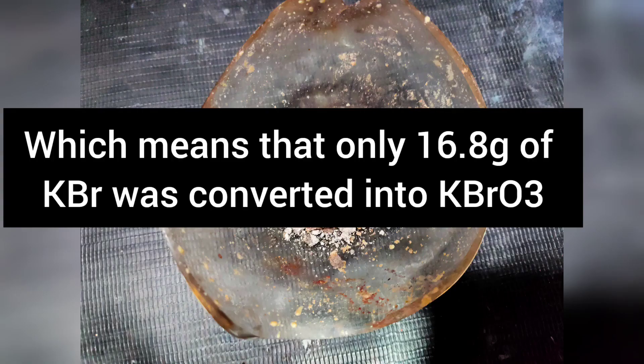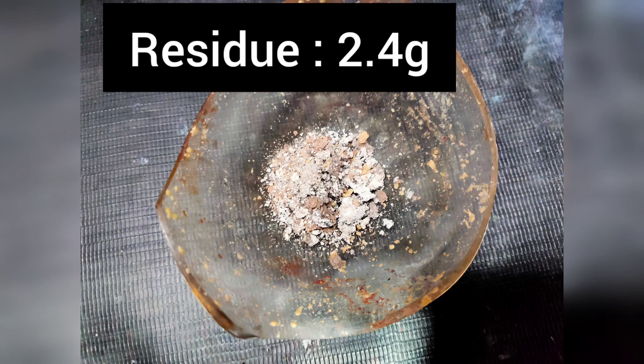Only 16.85 gram of potassium bromide was consumed in this reaction. On evaporating the filtrate to dryness, I got only 2.4 gram of potassium bromate or you can say any solid I got.